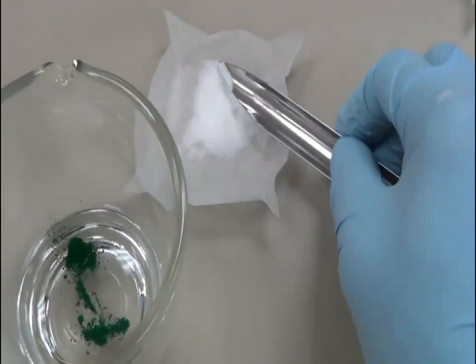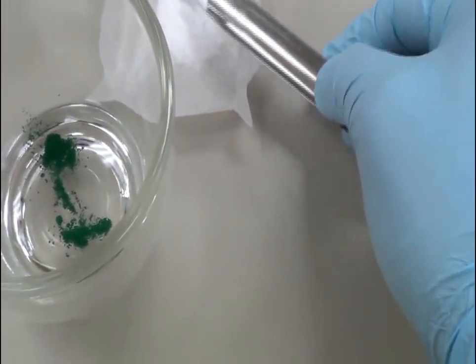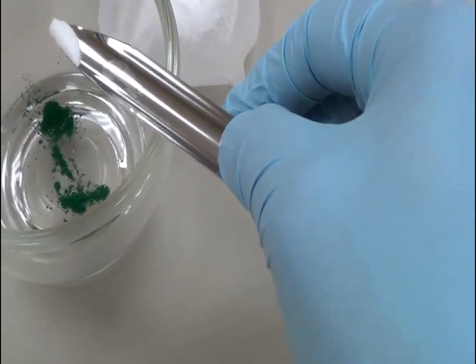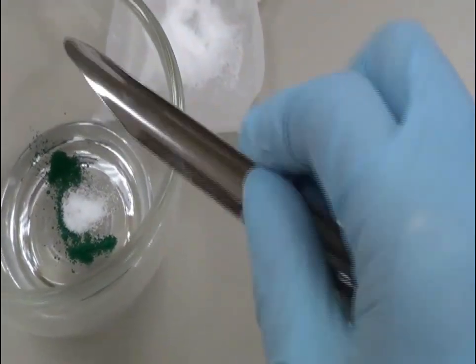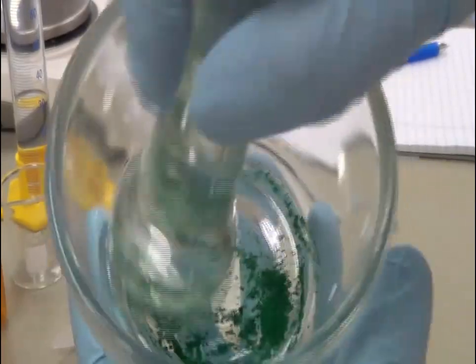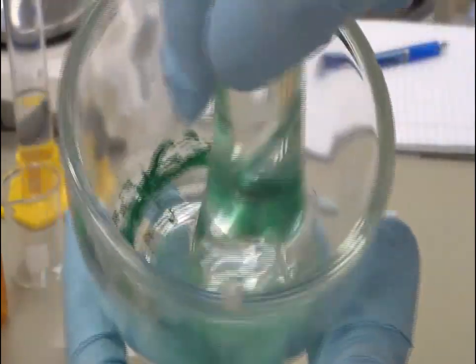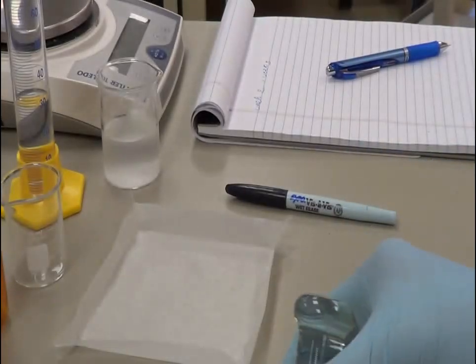Ascorbic acid is used as an antioxidant. I am going to transfer approximately 0.2 grams of ascorbic acid into this mortar and now I am going to triturate them. This is geometric addition — I added approximately an equal amount of ascorbic acid and now I am triturating. Once I am sure it is homogenous, I will add some more.